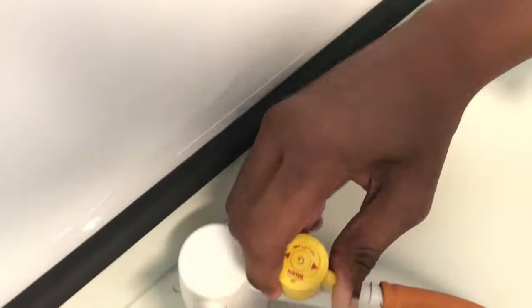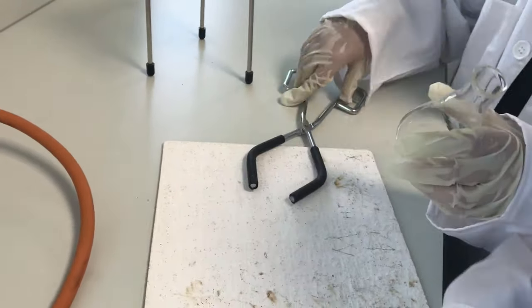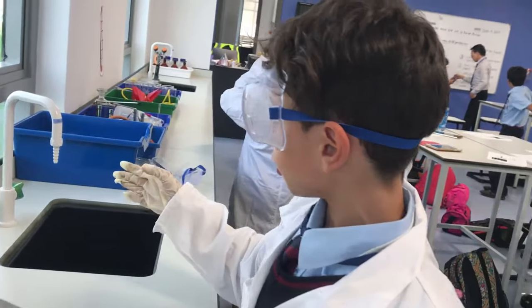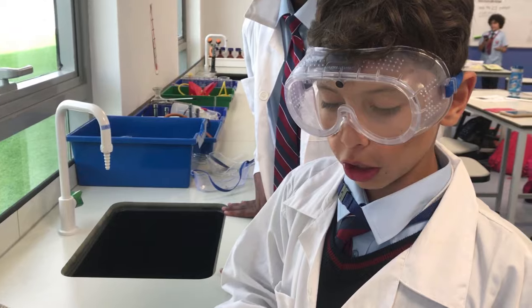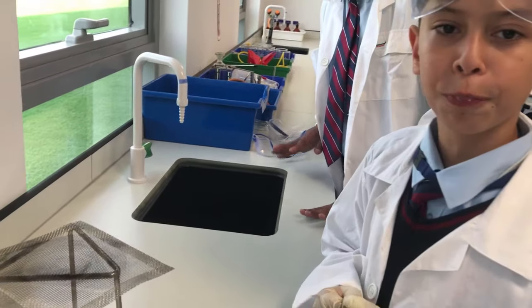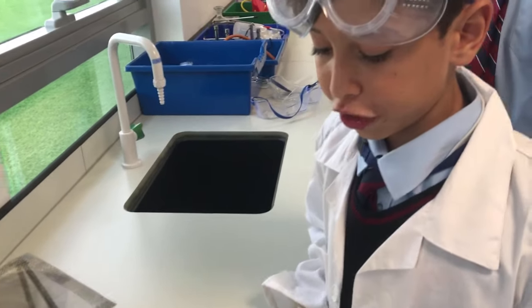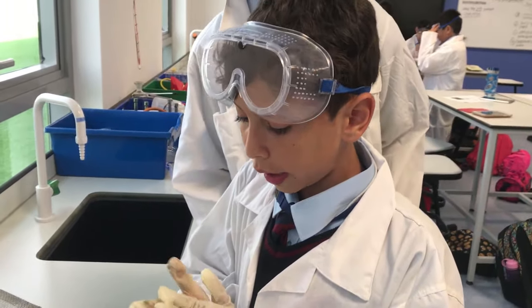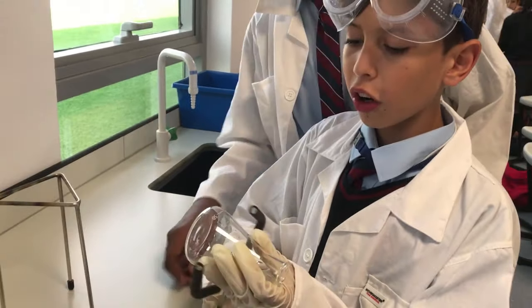Yeah, turn it off, put these away and just do what you want with your chemicals. Turn this off. Actually, I will show you, this could be hard with water. We're not using water. It could be hard to do that, but I'm not going to be doing that because that's going to be hard for us to kind of plug there. Our teacher doesn't want us to be using any water.